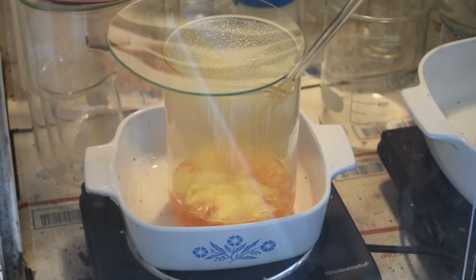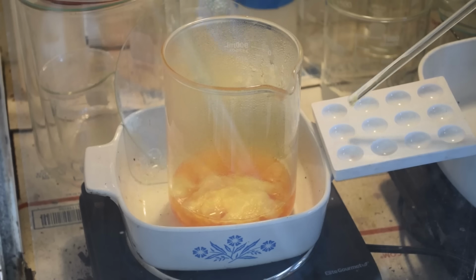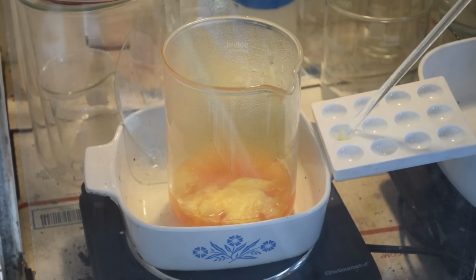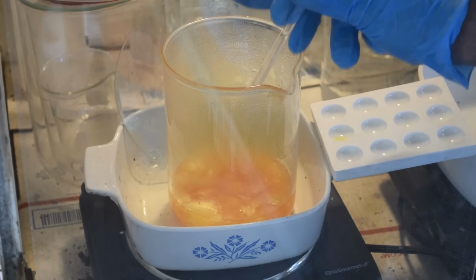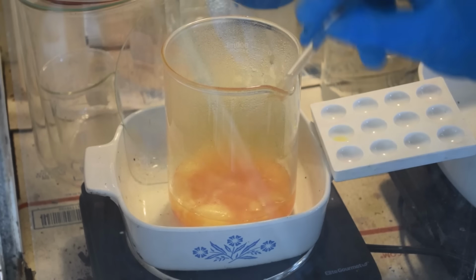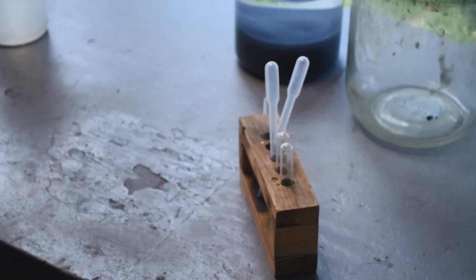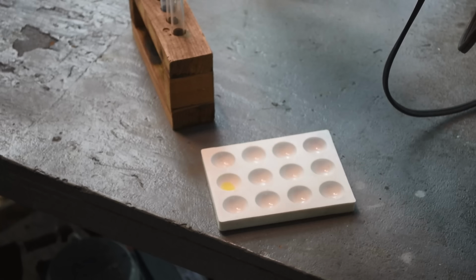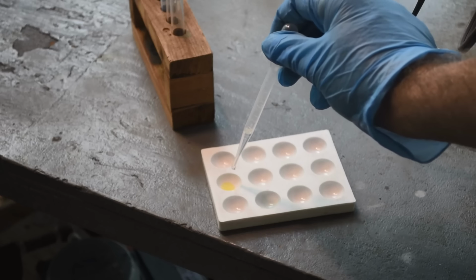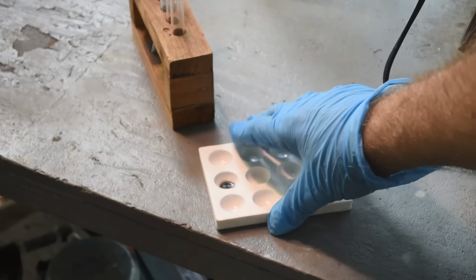So, I guess it's time for the moment of truth. Let's find out if we actually have any gold in this stuff. Some on the spot plate here. Stir it up a bit. Okay, let's do a stannous chloride test on it over here and see what we've got. What do you know about that?